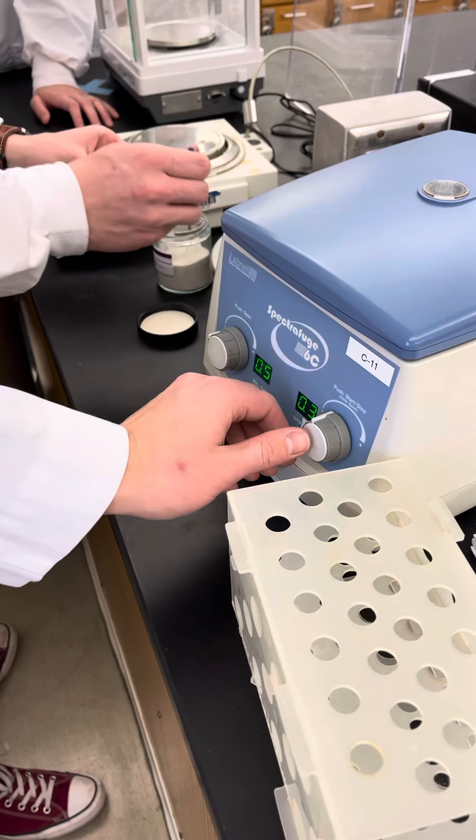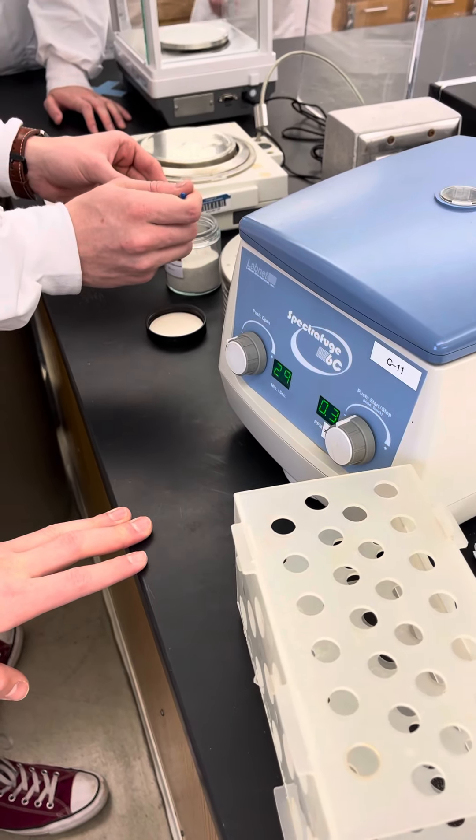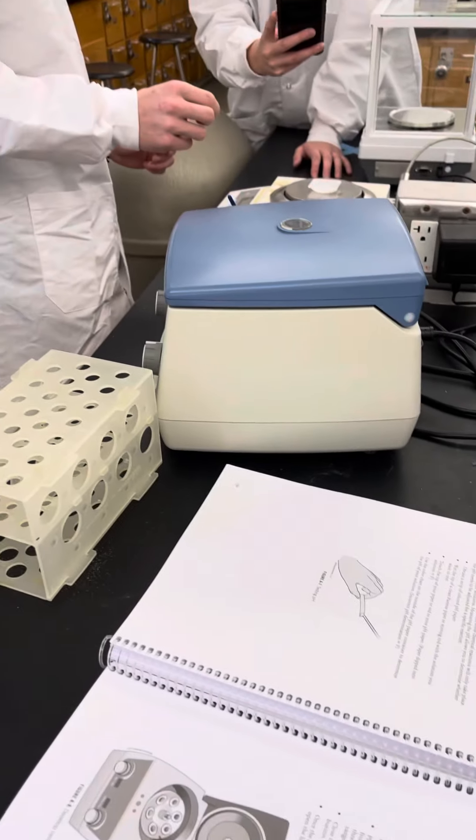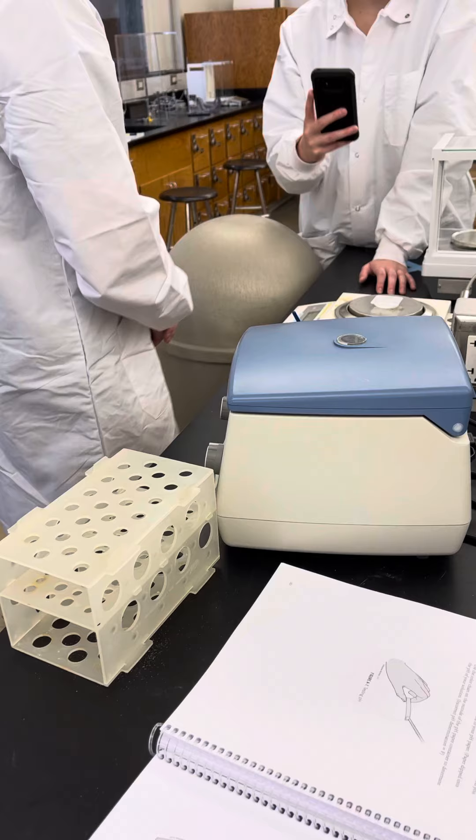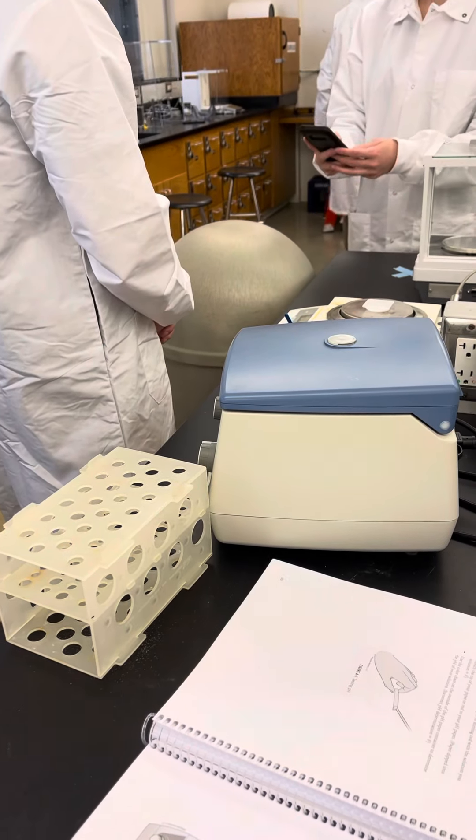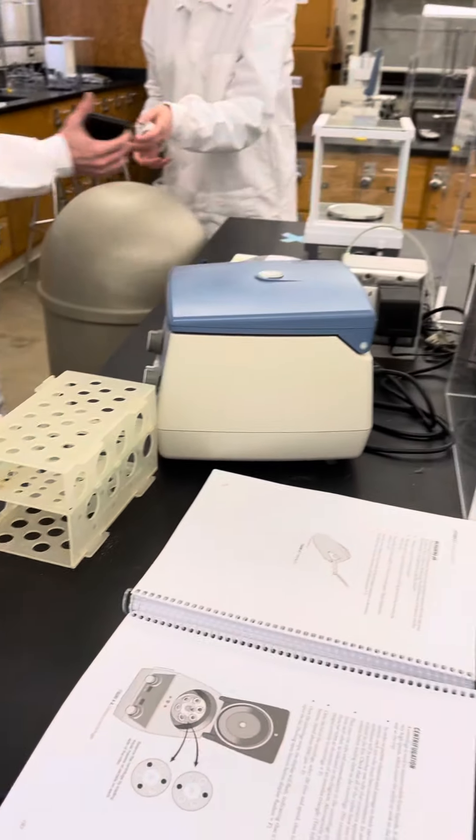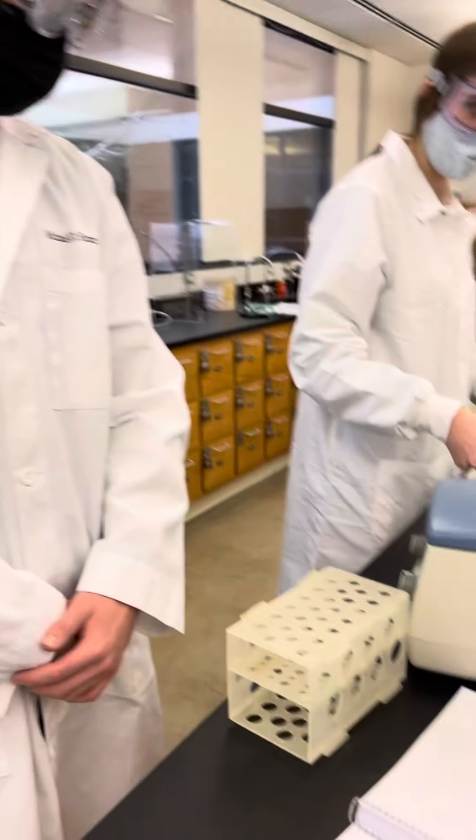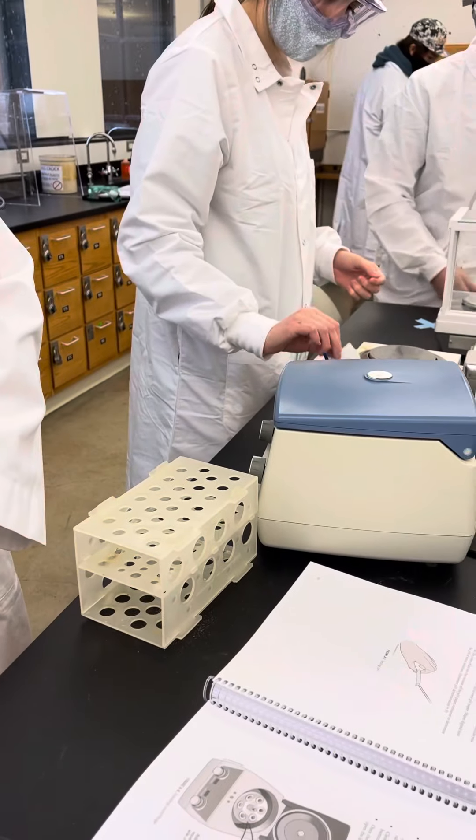Make sure it's closed first. You're going to scoop just a little bit off, and then re-measure until you get 2.25 grams. That was so lucky. That was the Lord's mercy, first time. Probably should do it.